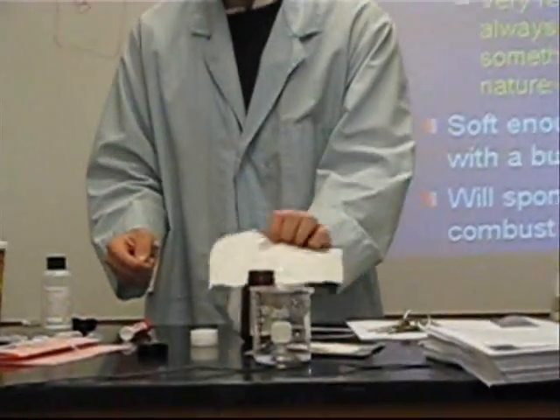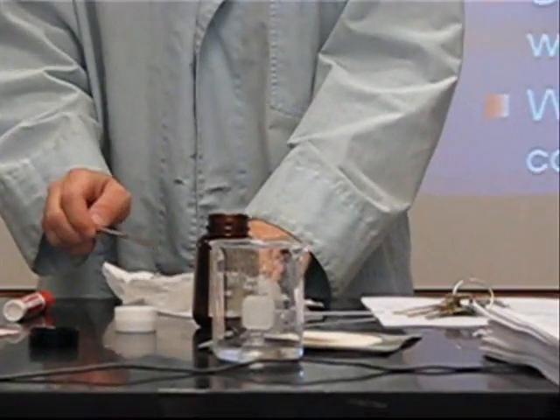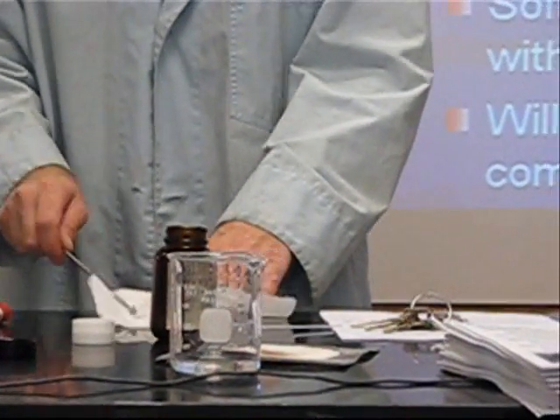You can't touch it? I would rather not because there's moisture on my hands. Oh boy, that could be... Oh my god, you just drop it.